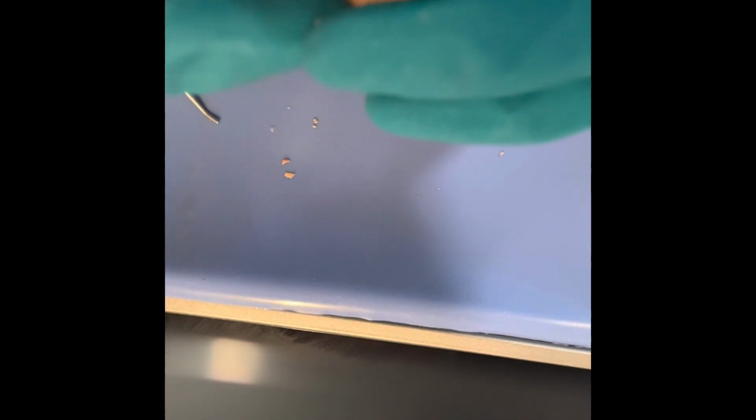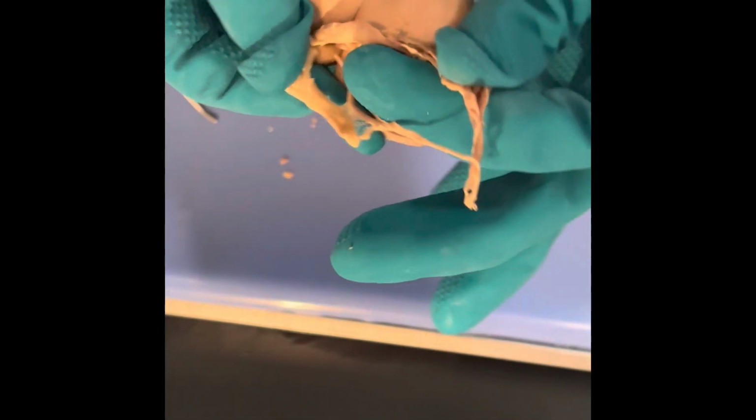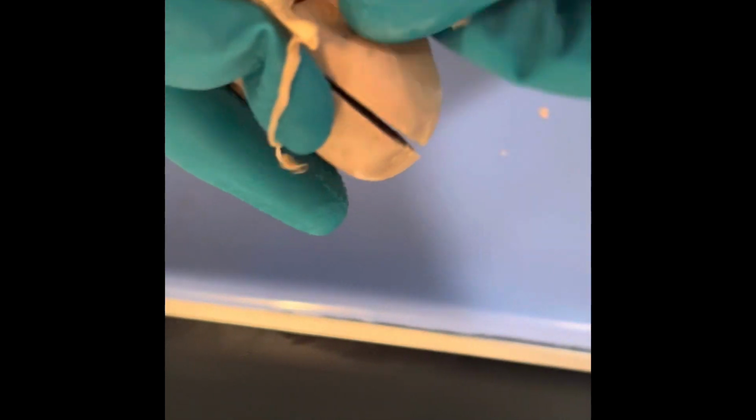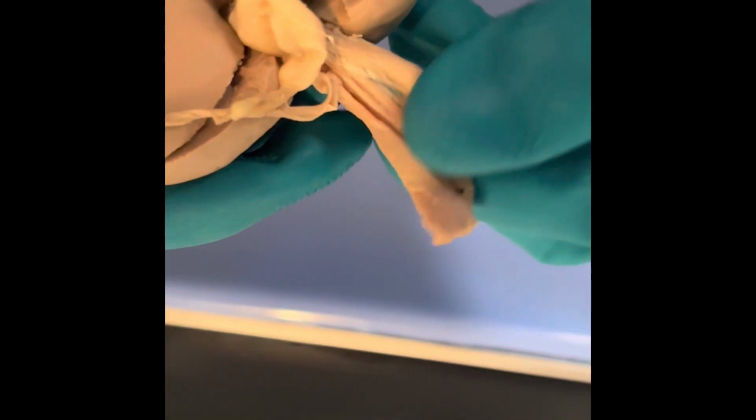This flat one, it's kind of hard to see because there's quite a bit of connective tissue. There is a flatter portion here. These are blood vessels. So the flat, more ribbon-like piece is going to be your renal vein. And then if you can see here, right there, it's connected to the vein. That's going to be your renal artery. That also enters into the hilum.